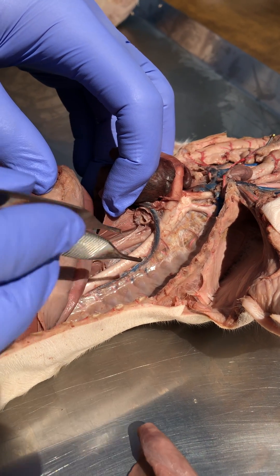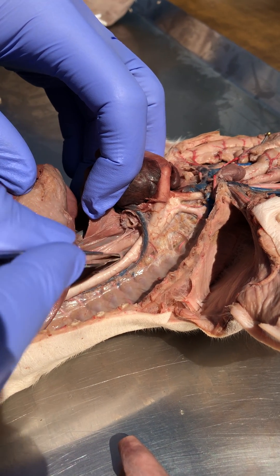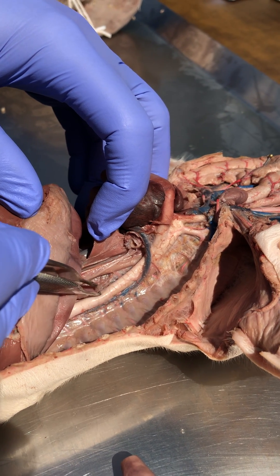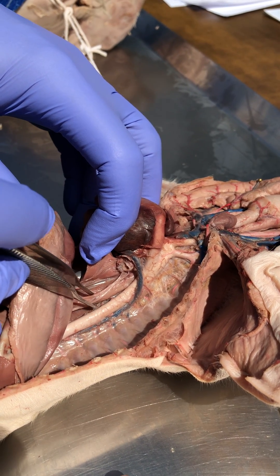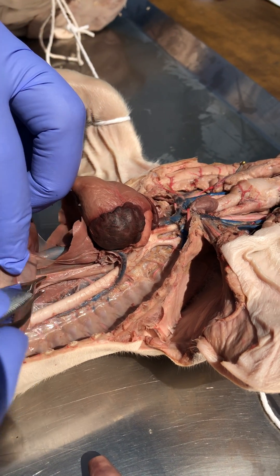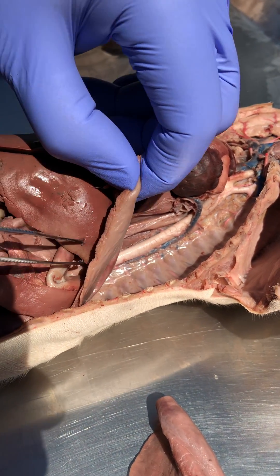My hand might be in the way there. Now we have another tube here connected by connective tissue — that's going to be the aorta, a major blood vessel. We'll get to that in another tour, but that's the thoracic esophagus, and that thoracic esophagus is going to pass through the diaphragm right here.